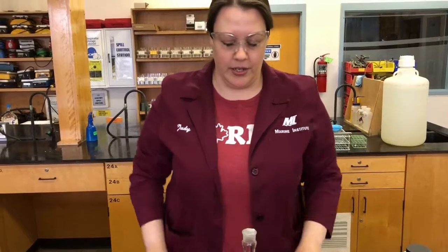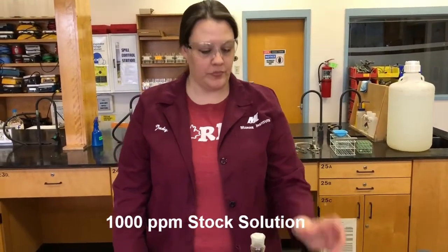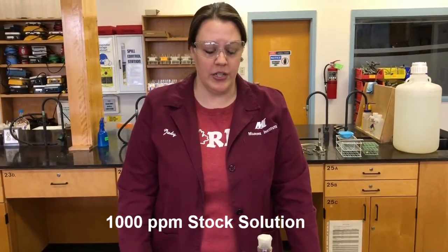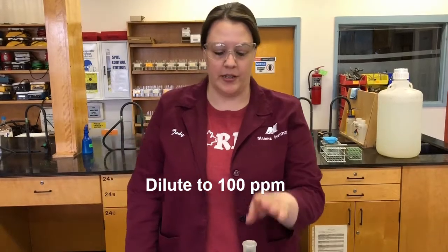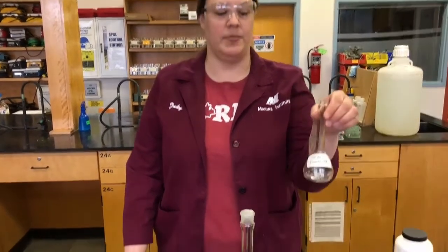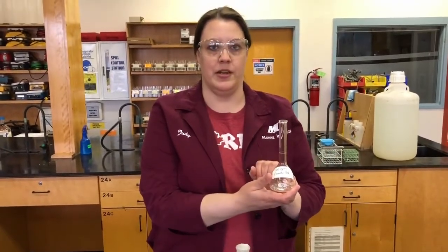Okay, good. So that is our stock solution, 1000 ppm. We don't often work with solutions that are that high in concentration, so we want to dilute it down to lower concentrations. We're going to start with diluting it down to 100 ppm. How do we dilute something down to 100 ppm? We're going to take a certain amount of the stock solution, put it into the smaller volumetric flask, and then like we did with the bigger one, top it up to the line.